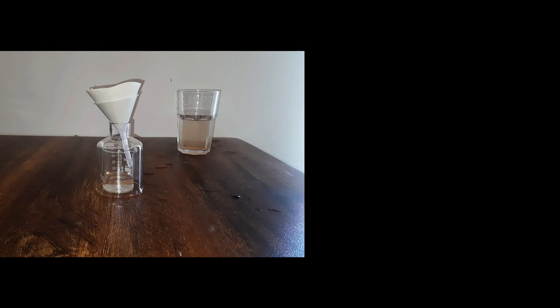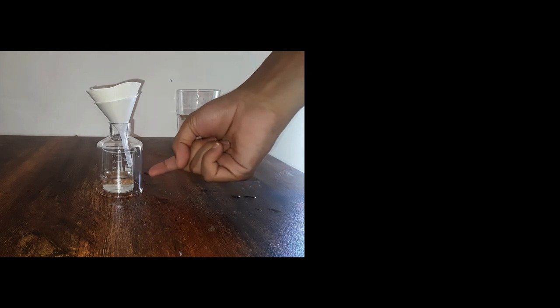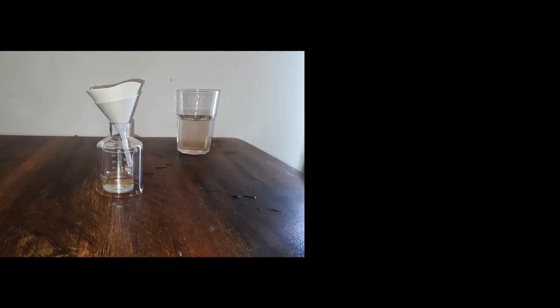When I pour the mixture, the filter paper filters out the sand particles and lets the water pass through, which is then collected in a container at the bottom. You can see that in front of you.